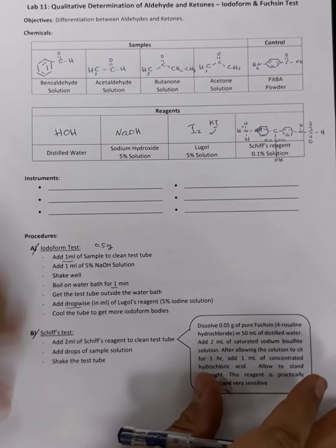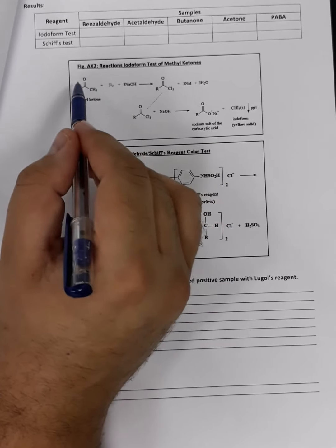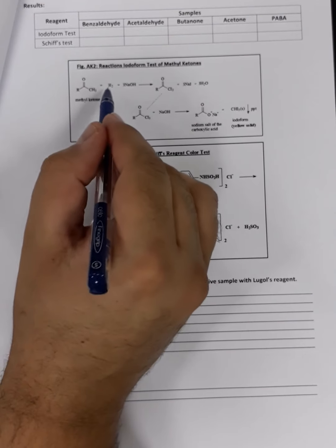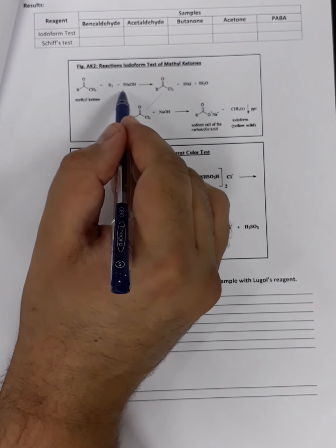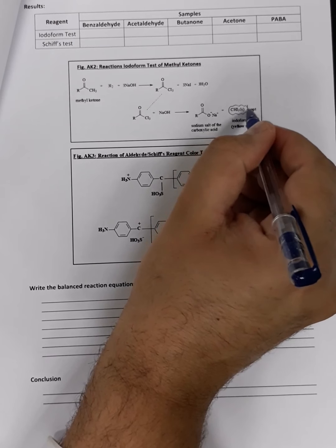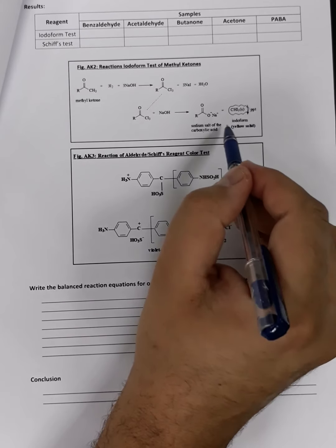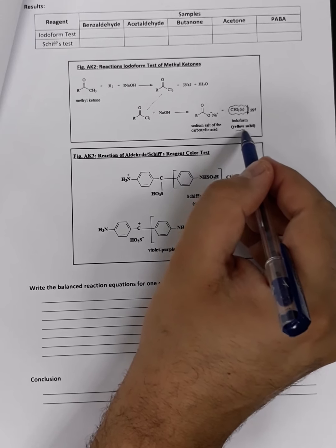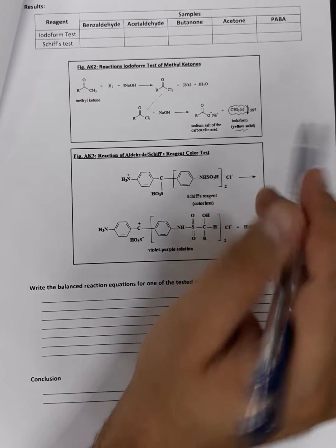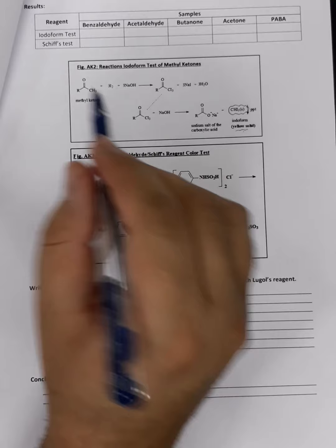What are iodoform bodies? We have to go to the chemical reaction to explain it. Here is the sample, which in this case is a ketone. Okay, and we are going to react that ketone with iodine in the presence of basic media, which is provided by sodium hydroxide. This reaction ends up with the formation of a certain chemical, which we call the iodoform body. Okay, this iodoform body has a yellowish color. So if I find yellowish bodies or yellowish granules at the bottom of the test tube at the end of the experiment, it indicates that this sample is for sure a ketone.